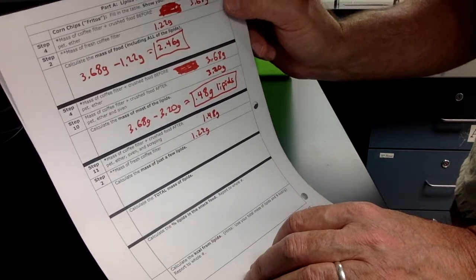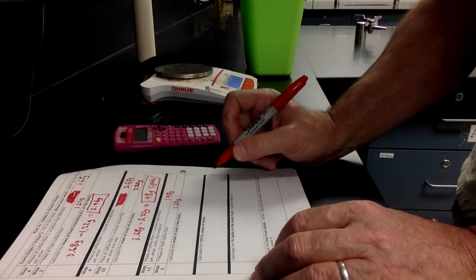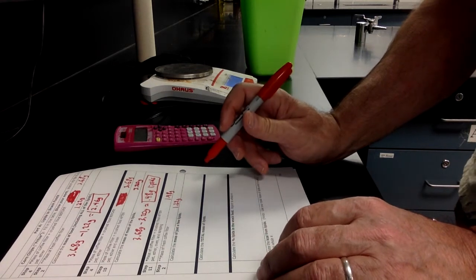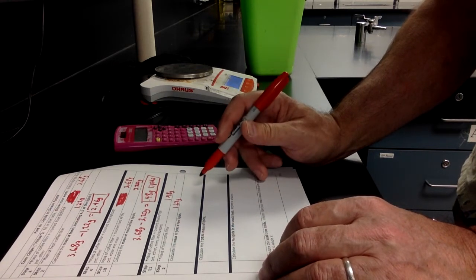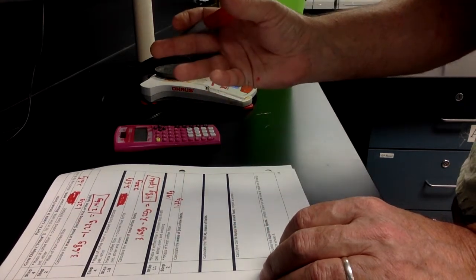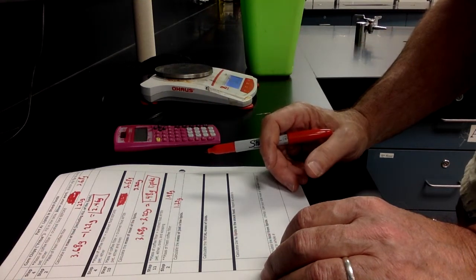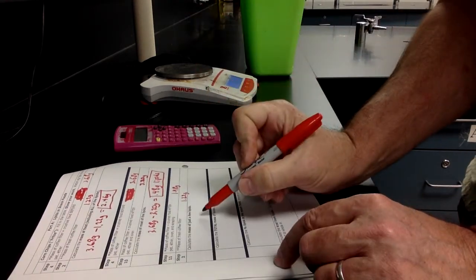that were dissolved out by the petroleum ether. Now notice it says mass of most of the lipids, because remember there was some lipids that were actually stuck to the paper. So that's the lipids that dissolved in the petroleum ether and went through the filter paper, went through the funnel, and came into the flask underneath the funnel. But what about the lipids that stuck to the filter paper? So we're going to do that one next.